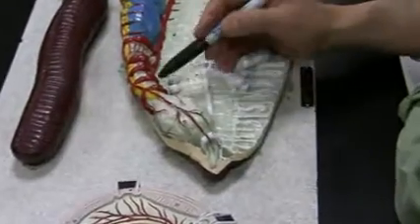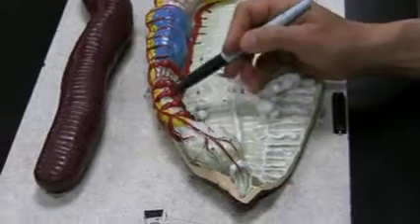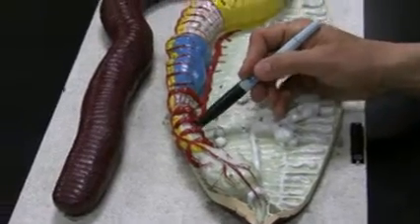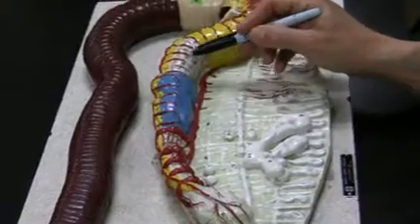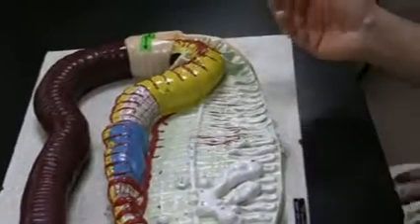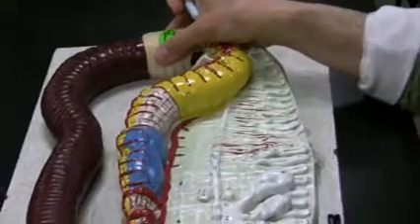Right here is pharynx. These are aortic arches. You have 4 or 5 of them, or heart. And then underneath of it is esophagus right here, and then it goes to crop, gizzard, and then calciferous glands here, dorsal blood vessels, ventral blood vessels, intestine, and goes to clitellum. This is clitellum right here.